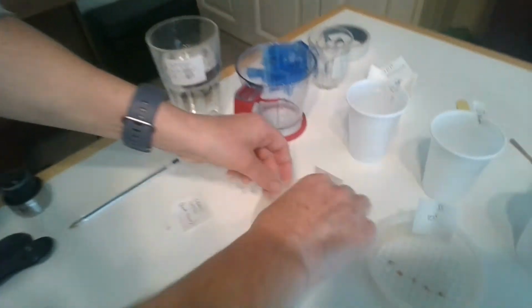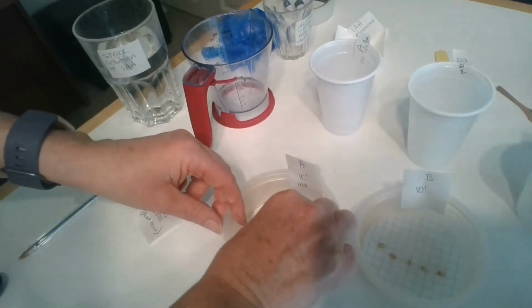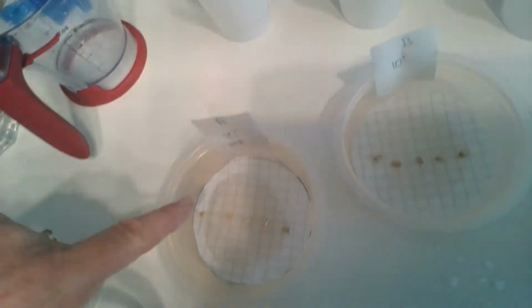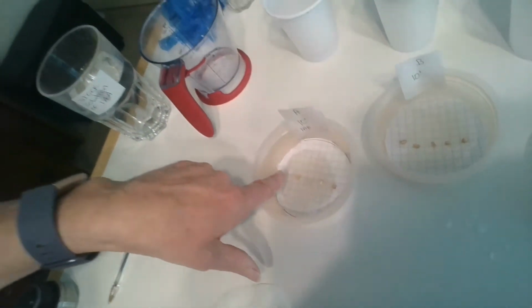And into the Petri dish, I take 5 seeds. We are using cress seeds. You can use radish seeds. I spread them out and I put them into the middle, if you can see that. I put them into the middle of the Petri dish, okay? So I now have my acetate with my grids on it and my 5 seeds. The reason I use 5 seeds is we're replicating. It's important to have replicates, to repeat the experiment, and that increases the accuracy.